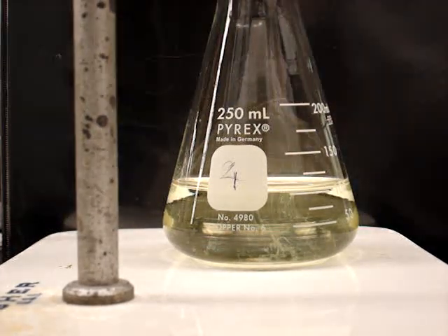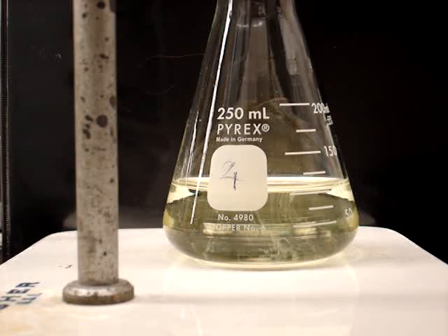Shown here is a titration for 100 milliliters of the unknown.